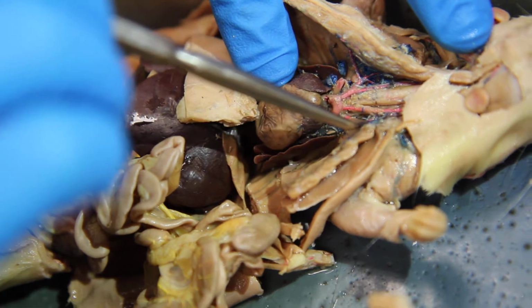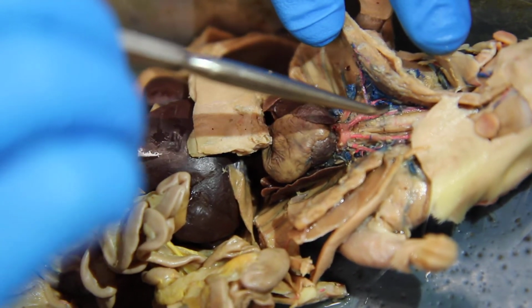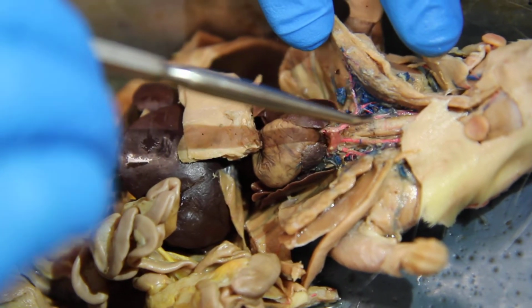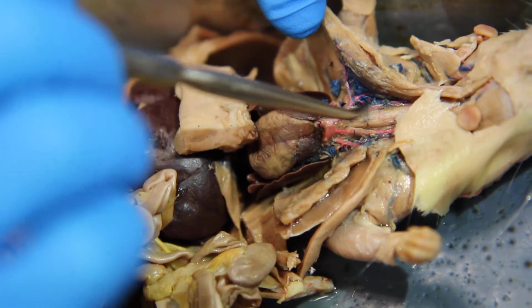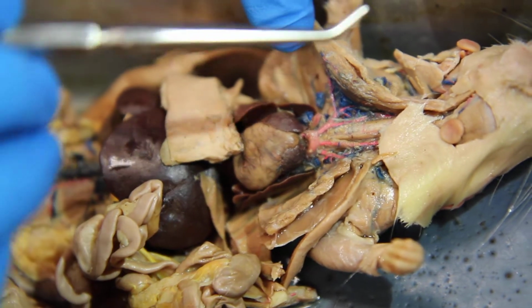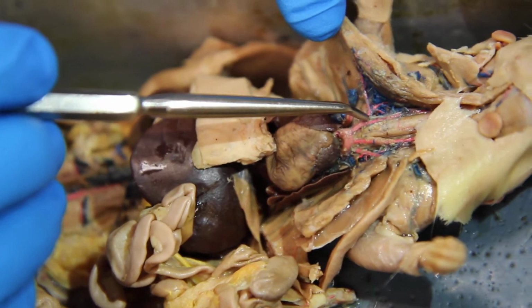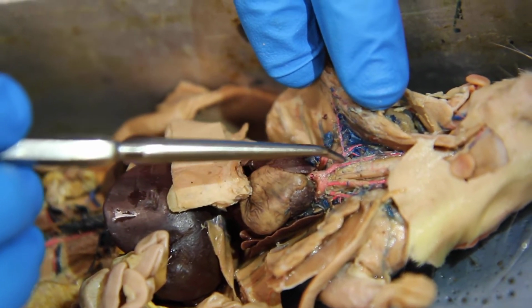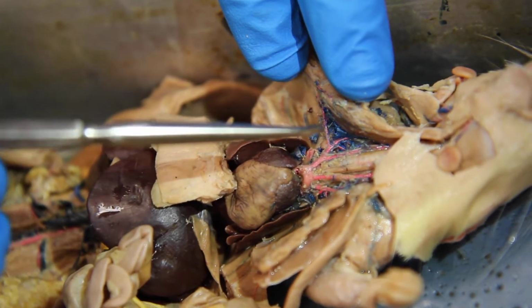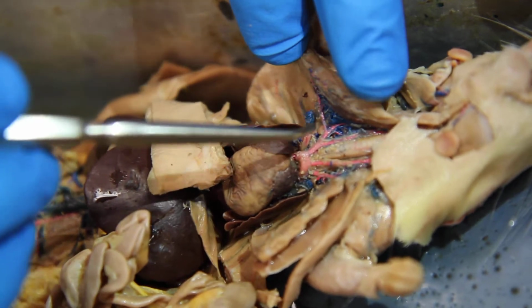Okay? So off the brachiocephalic trunk, the first split, this one goes up. That's the right common carotid. So it's relative to the rat. It's the rat's right side. Okay, right common carotid. And then the other split is the right subclavian, which is basically this whole thing right up to there. And then a bunch of stuff comes off of that subclavian, the right subclavian.